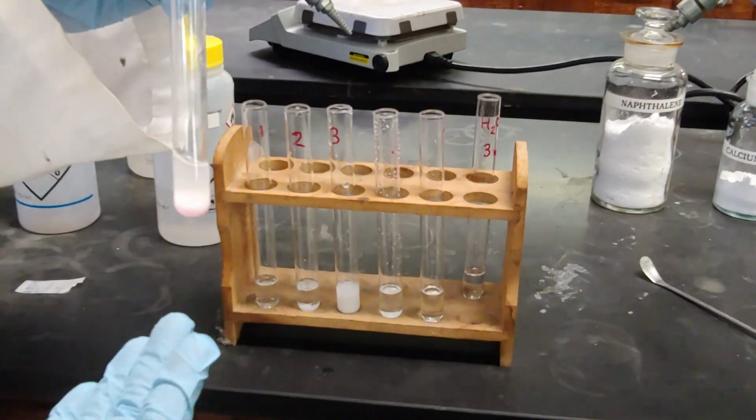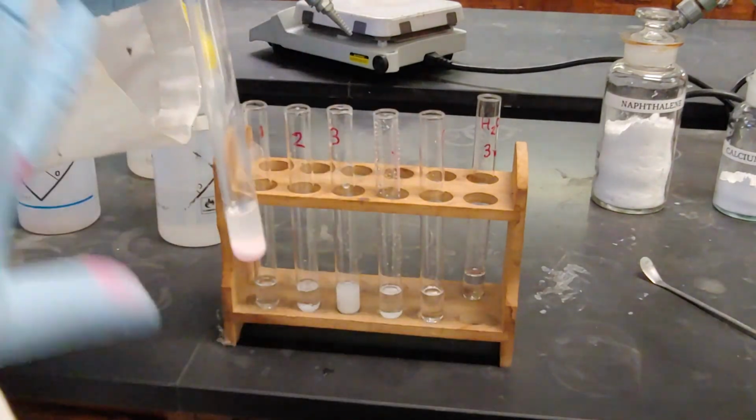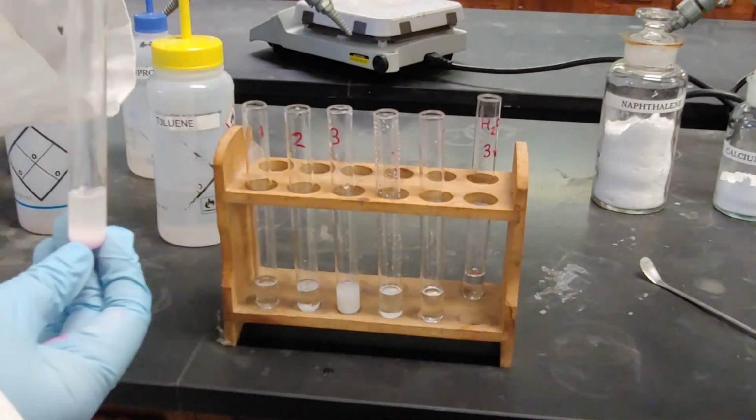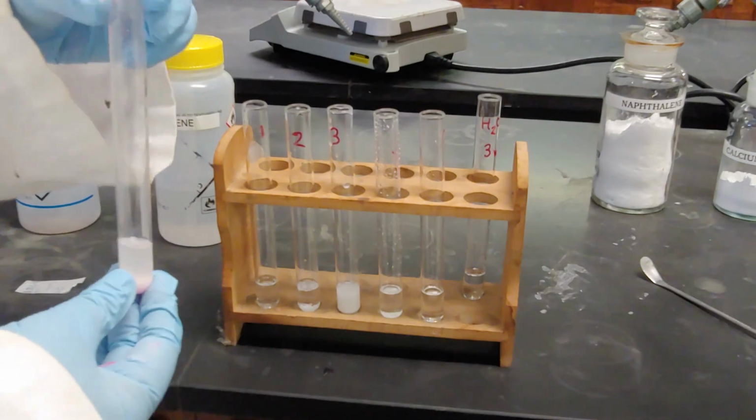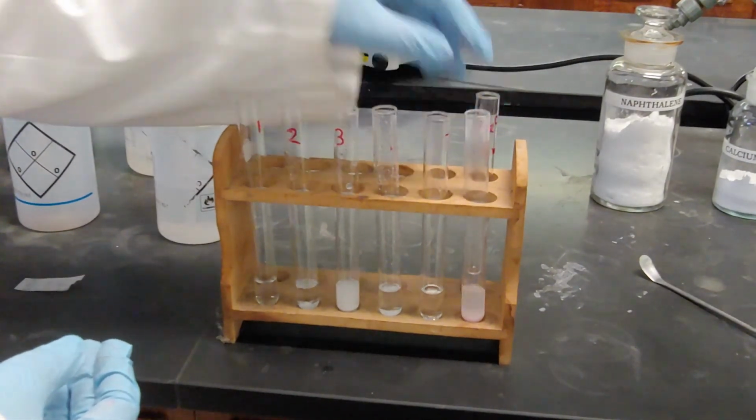When I was shaking them, the permanent marker that marked what number these test tubes were got into my gloves, and that got into my solution. So that is why you should actually use the parafilm to cover things instead of just using gloves like I did earlier.